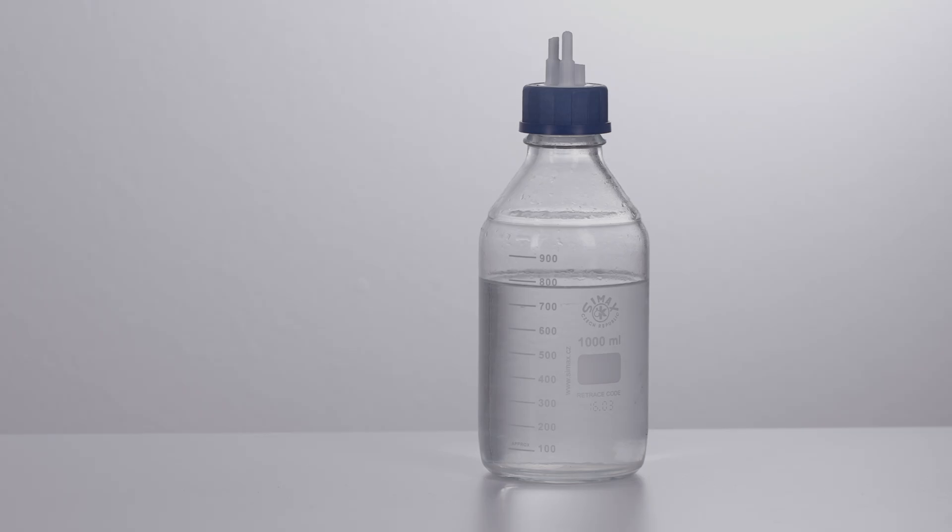With every degassing procedure we recommend that you degass an additional bottle of deionized water.